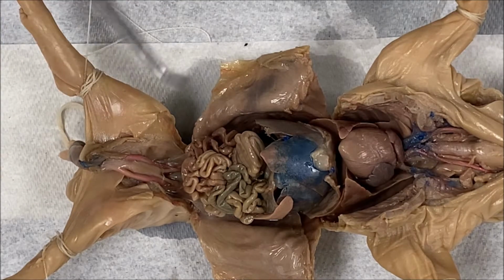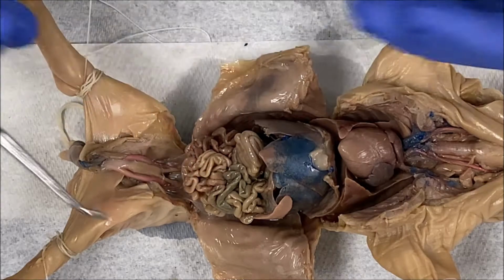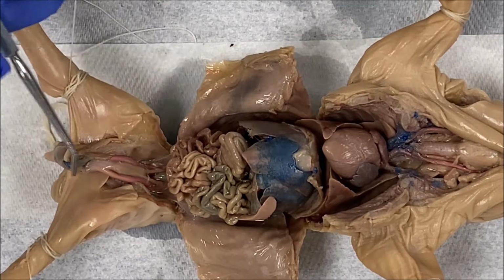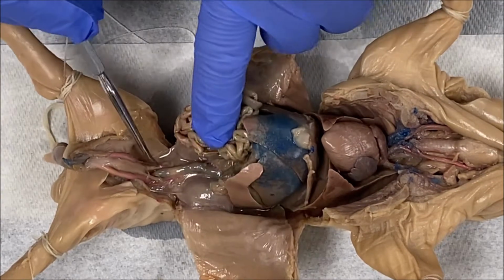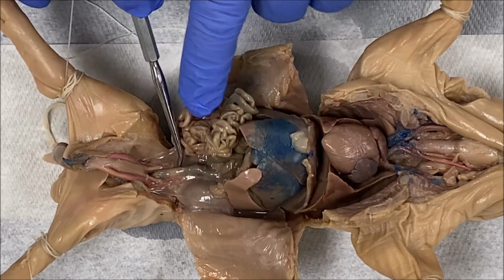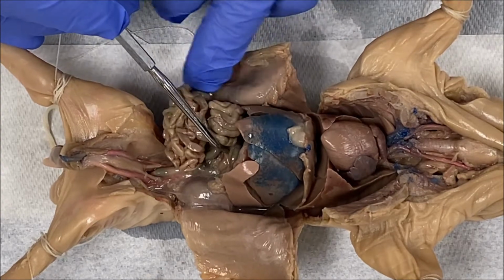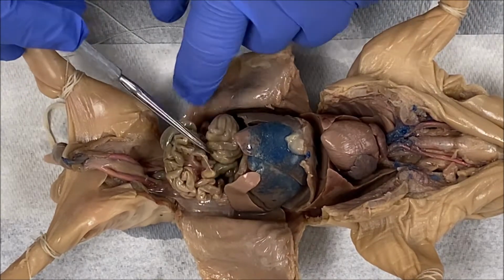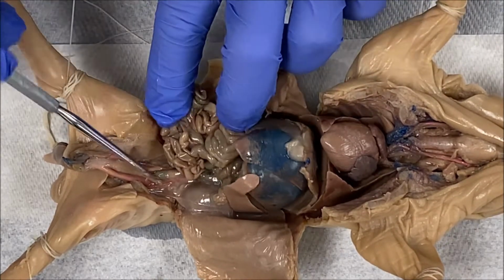And then the ileum is a little more challenging to find, right? Because that's where the small intestine attaches to the large intestine. The easiest way to find that is to actually find the large intestine, right? So here's the rectum down here, and then here's your large intestine, and then trace this backwards. So if I just trace the large intestine backwards, I will come to this structure. So there's the large intestine, but if I keep tracing backwards, right?